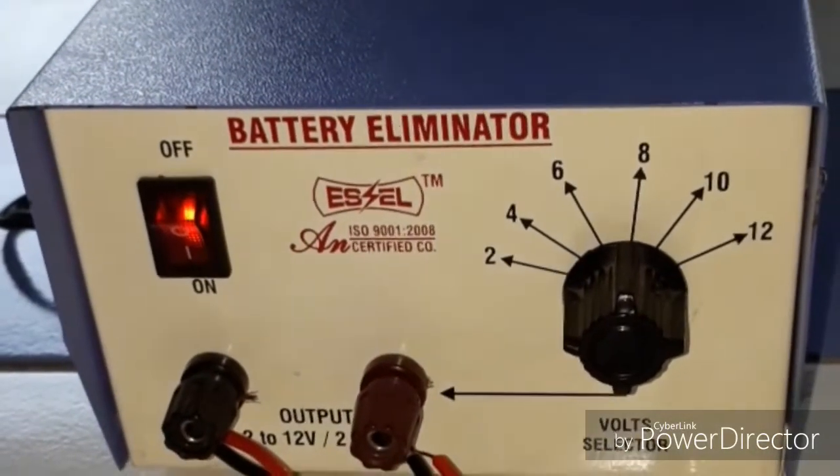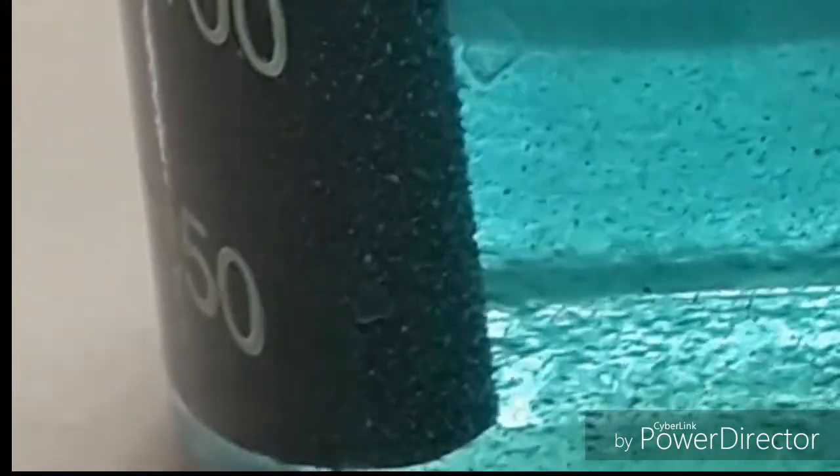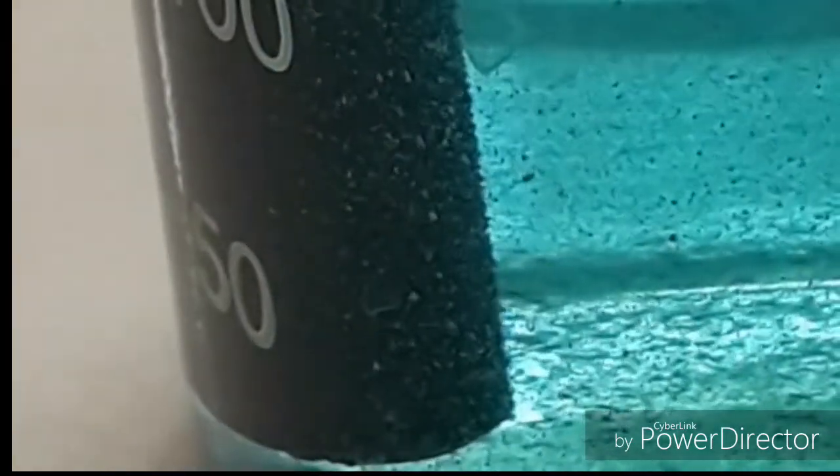So here's the process going on. This is the rectifier, which converts the AC into DC, and this is our assembly, which is looking this way. Crocodile clips are connected over there. I'm going to start this experiment. This is the cathode, that is your negatively charged electrode, and you can see the reaction has begun. I have just switched it on. The voltage is 4 volts I've applied, and this is your anode, and the chlorine gas is liberated.